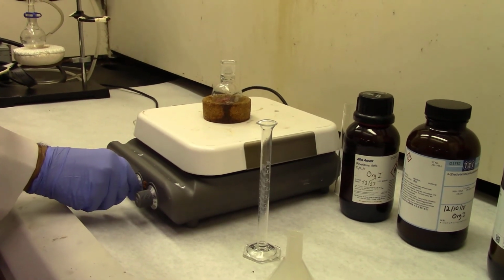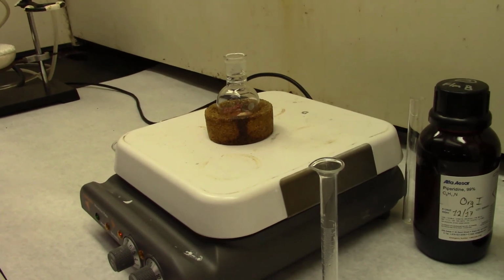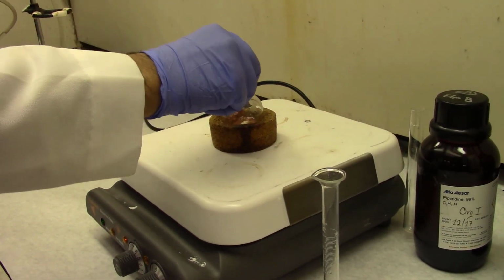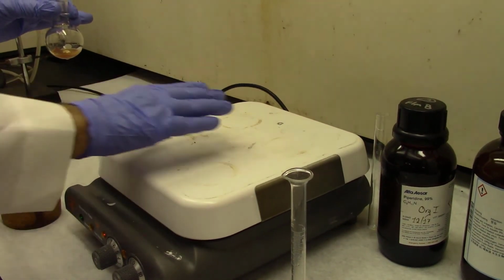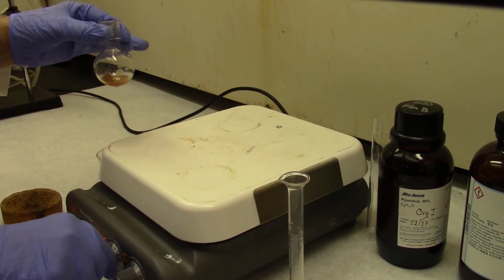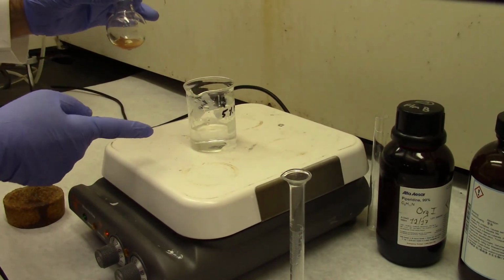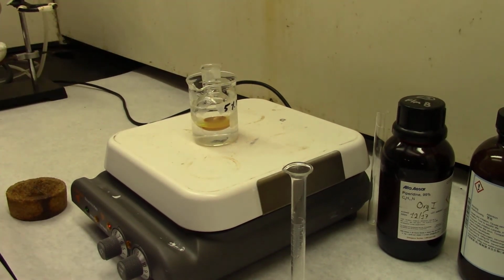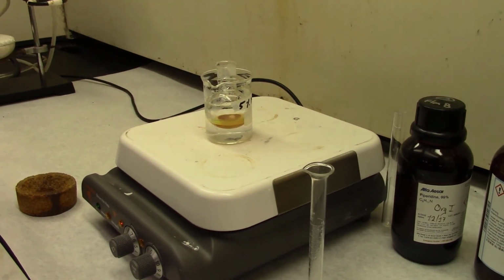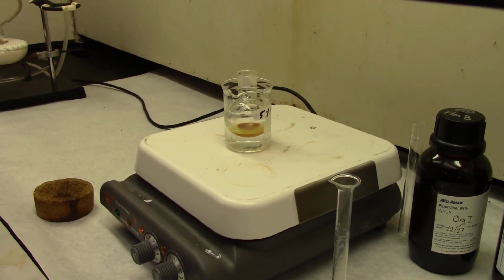20 minutes, but it probably will not dissolve at room temperature. We may have to actually heat it a little bit, warm it actually, not heating but warm. This reaction should take place at room temperature, but it requires a little bit of solution, just a softening of the reactants. So use water in a small beaker and warm it very low, using a low heat. As soon as the solution occurs, the whole thing dissolves, then remove it from heat.